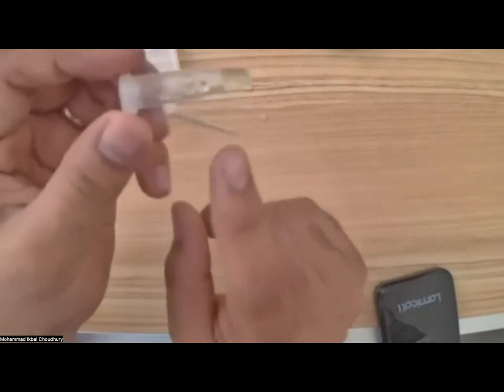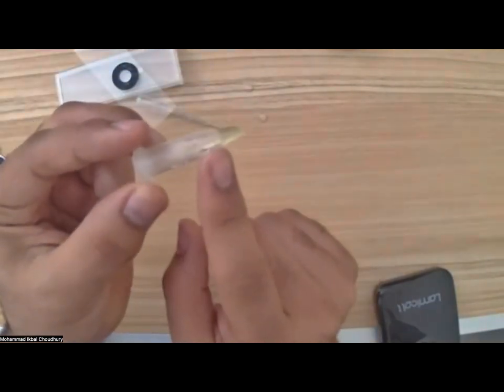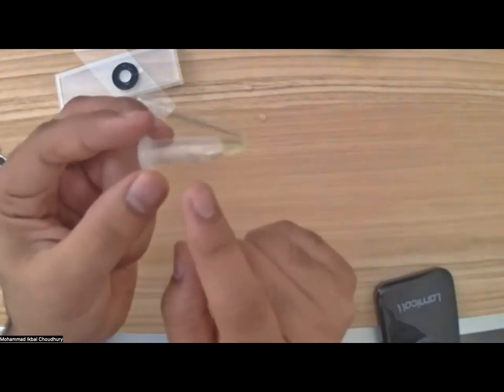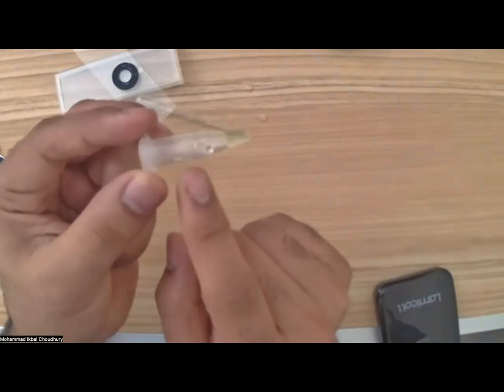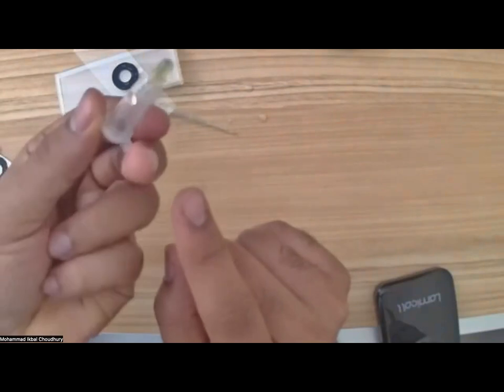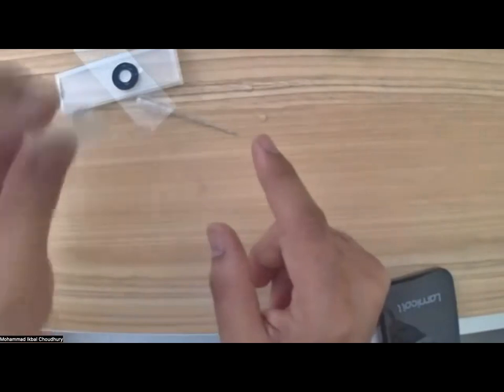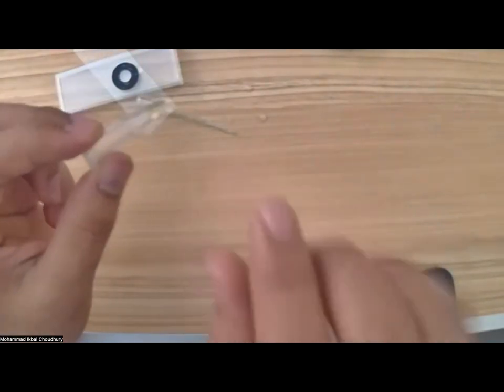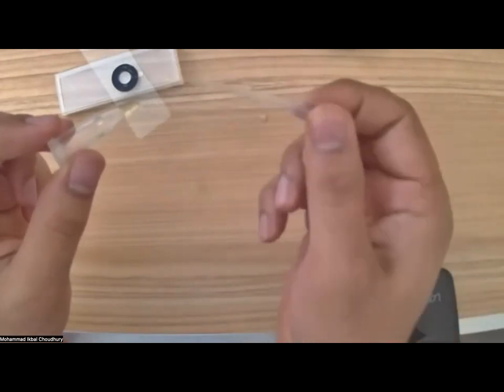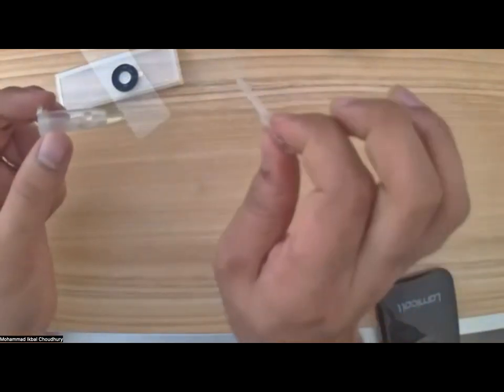Here you may or may not see that the water looks a little greenish, right? These are not filamentous algae. I don't know what they are. I just picked them up. So we will all visualize together. They look grainy to me, and I can't really make any predictions. They're sticky, so they're sticking to the wall of the tube. What I'm going to do is I'll just stir it up, pick up some sample using this pipette here. I'm sure we all have used things like that, right? So you squeeze it, you pick up some sample.